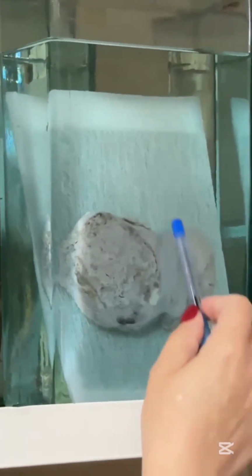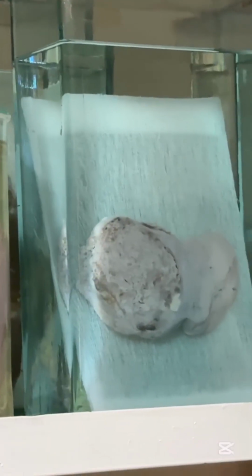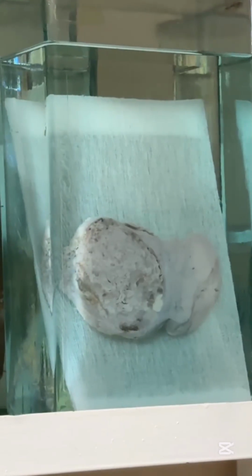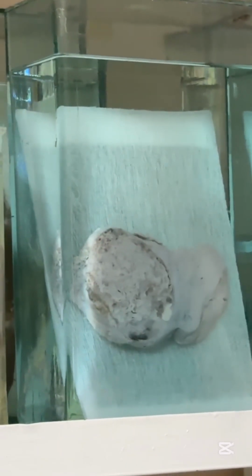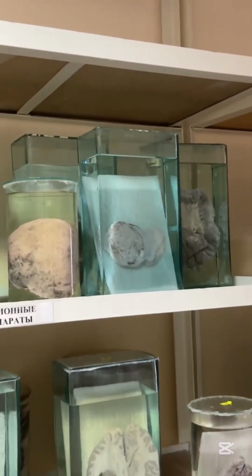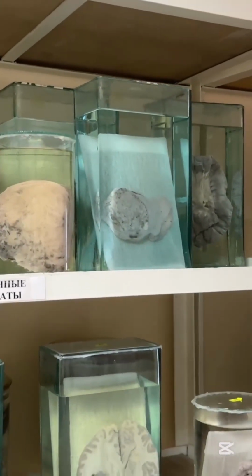You want another kidney. This one. Again kidney, again tumor. You should rotate to normal position. That is normal part, that is tumor. Compare normal part, it is bigger in comparison with this. So adult kidney. Most common tumor, renal cell carcinoma, or another name is clear cell carcinoma. That is microscopical characteristic because tumor cells collect fats, lipids. Fat was dissolved during fixation, during staining, and we can see a clear cytoplasm, white spaces in cytoplasm.